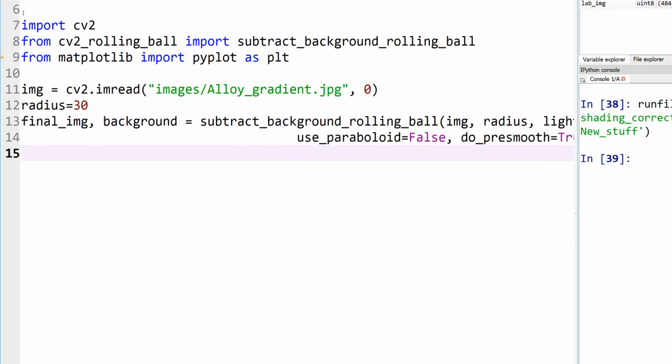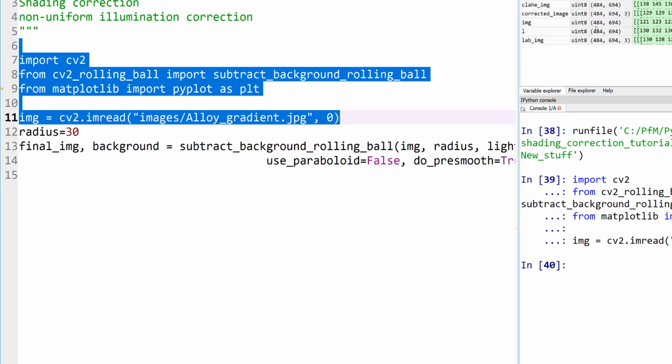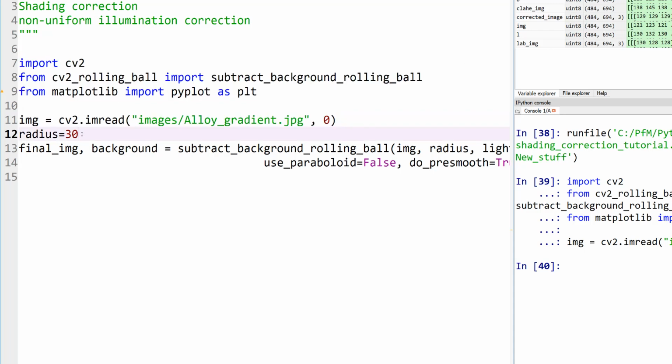First of all, let's run up to this here. You can see my image here is 484 by 694 in dimensions. So for that, I'm defining a radius of 30. Let's see how well of a job it actually does. Now the rolling ball actually gives you two outputs. One is your corrected image and the other one is the actual background, so you can see how the subtracted image looks.